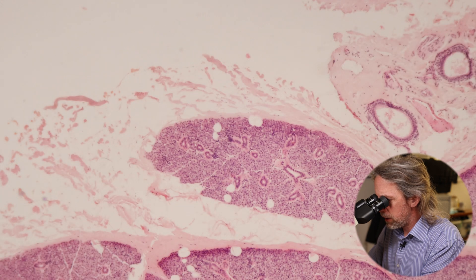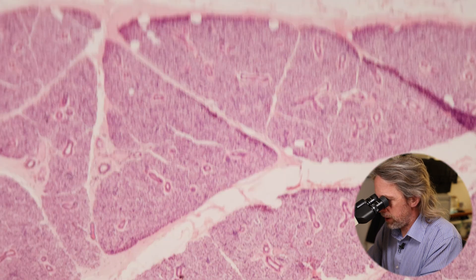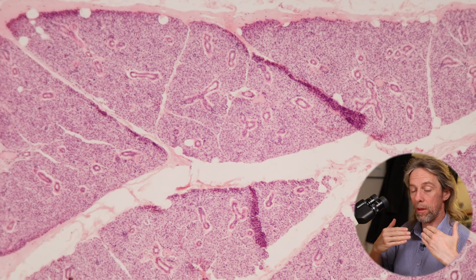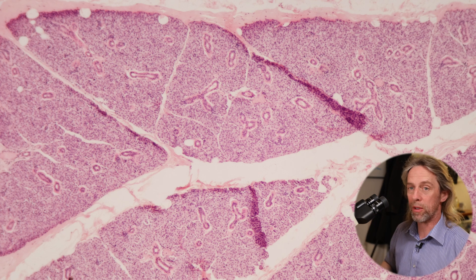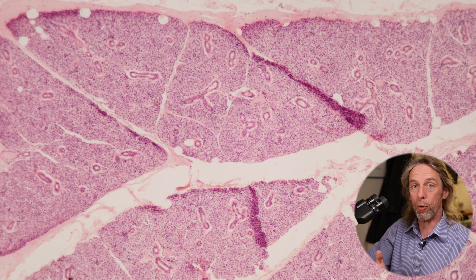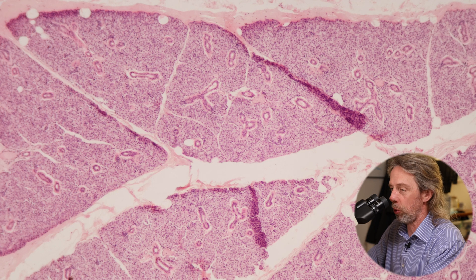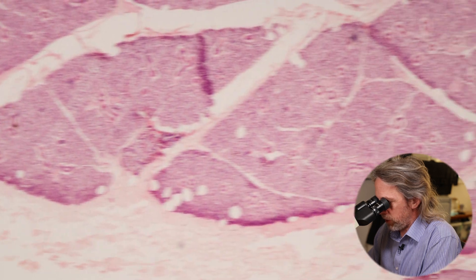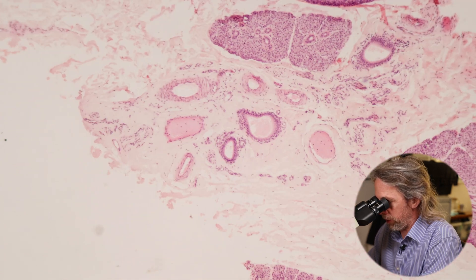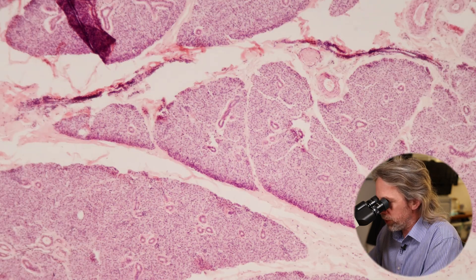This is the parotid gland. Of the three glands, we have serous cells secreting a serous solution full of proteins and enzymes, and we have mucus-secreting cells which secrete mucin — more of a lubricating solution. Some glands produce a bit of both, but the parotid gland produces almost entirely serous secretions. At low power on my 4x objective lens, we can see that around the glandular tissue there's lots of connective tissue, and within that connective tissue we've got blood vessels, lymphatics, and nerves.